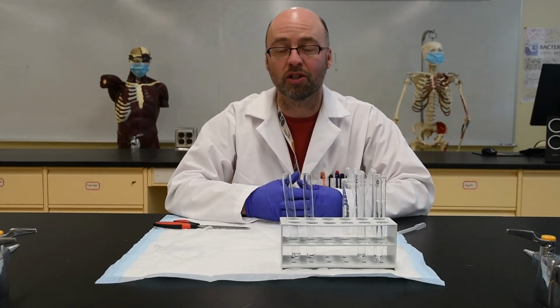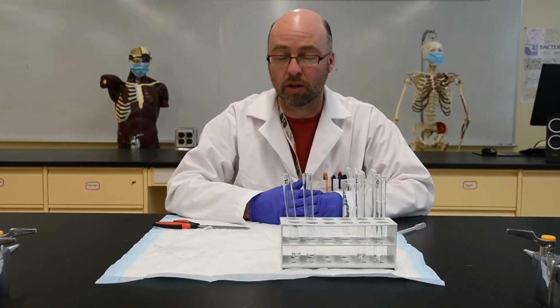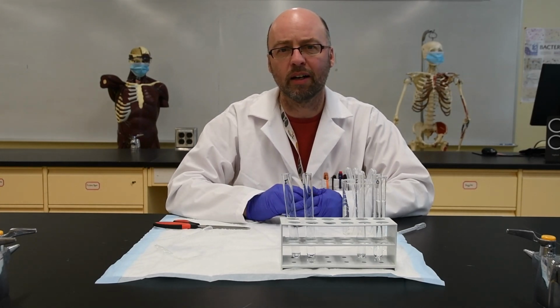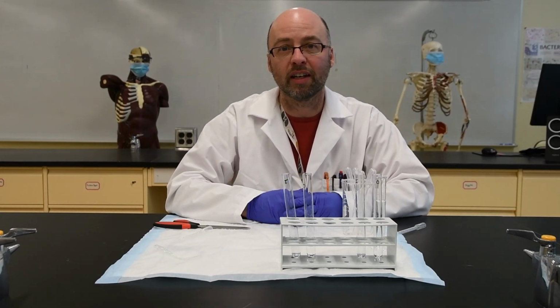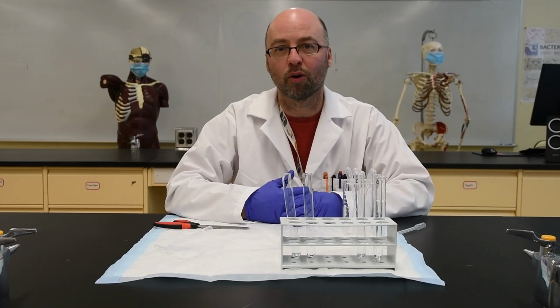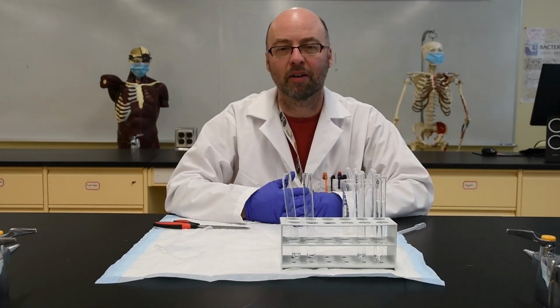So use your knowledge to figure that out, and those questions will be on Moodle for you. Another consideration is, what do you think happened to water? Given that you have distilled water on the outside of the membrane and a highly concentrated solution on the inside, what do you think happened to the water? Water can pass through the semi-permeable membrane, so that's a clue for you. It either went into the bag or came out of the bag, and that will be a question in Moodle as well, so be thinking about that too.